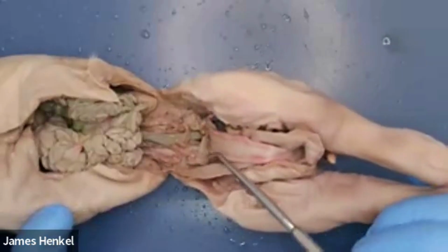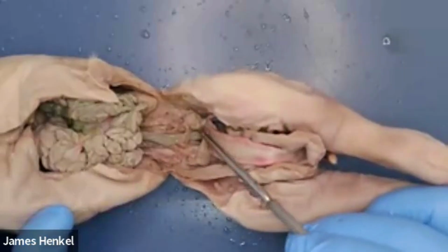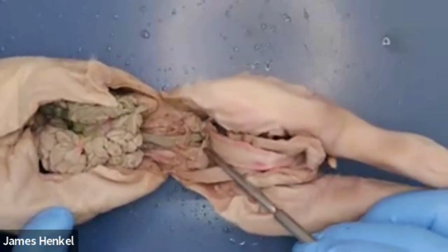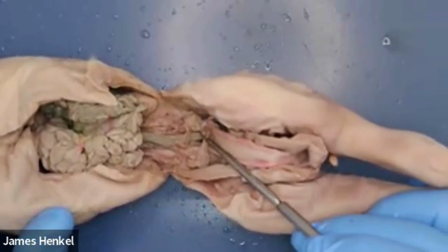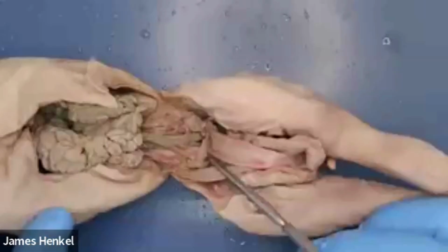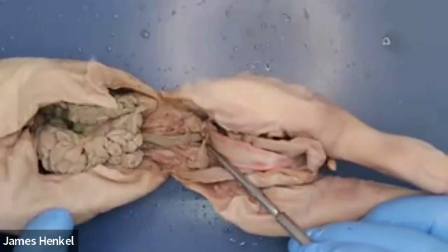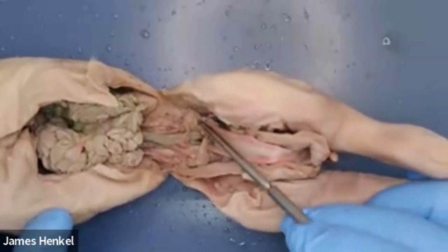This is very common in animals that produce large litters, anything above really two animals, and even sometimes one. So they will gestate in the actual uterine horns. The uterus comes together as technically a uterus, but that is not where they are gestated. It's the horns of the uterus. And it comes together underneath the bladder there, and then ends in the cervix. And we'll see the cervix on the other side in a little bit.